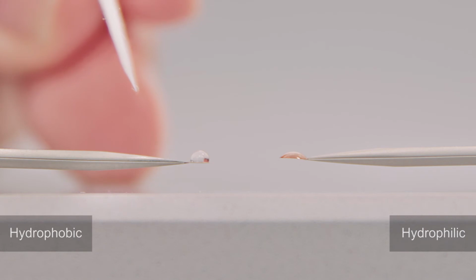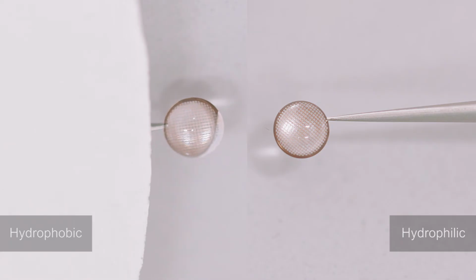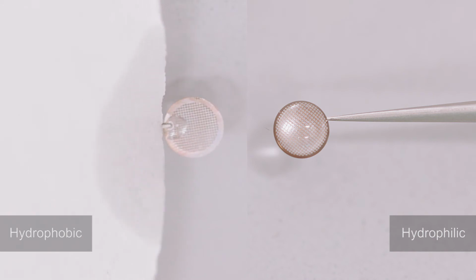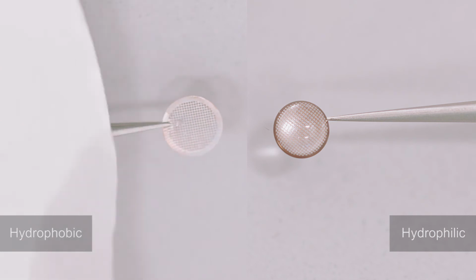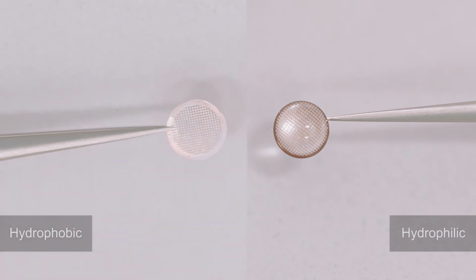So if we would blot a droplet on a hydrophobic surface, what you might notice is that you can take the full droplet clean off from the surface in such a way that the surface is actually, like so, completely dry again. So the danger that you have is when you have a hydrophobic grid and you apply a droplet of water and you then blot, you blot away all of the liquid and you do not end up with a film.